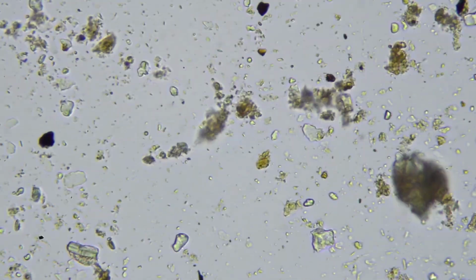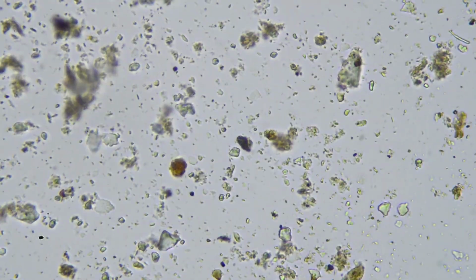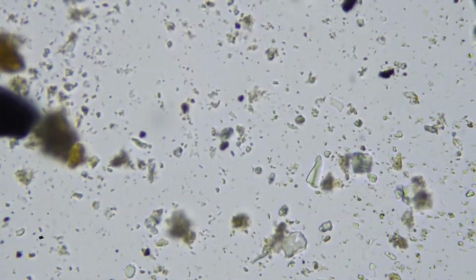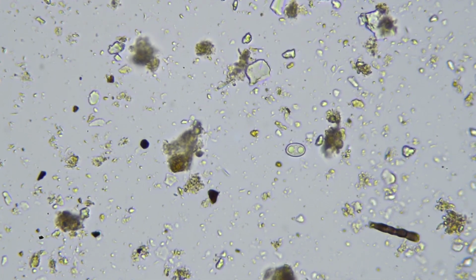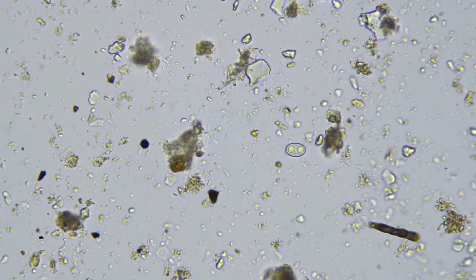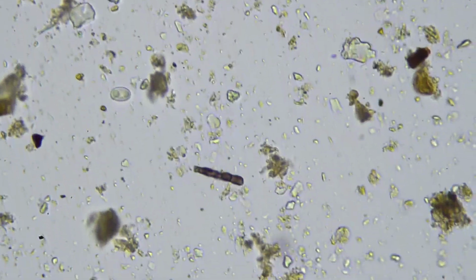These minerals should be getting incorporated into these aggregates to be broken down by primarily fungi. They've got the enzymes capable of breaking apart these kind of matrices and accessing the nutrients held within them. There's a spore there, or possibly a diatom. You see in the center the thing with two blobs, right in the center there, that is some sort of fungal spore. I couldn't tell you what species, only that it's not Basidiomycetes, but I couldn't tell you any more than that.